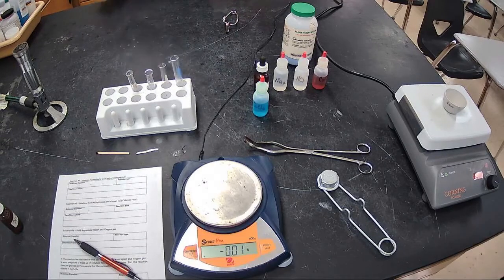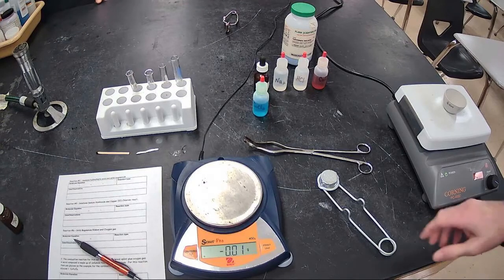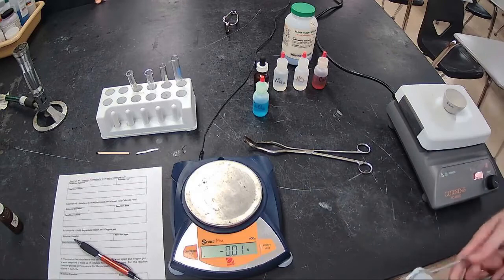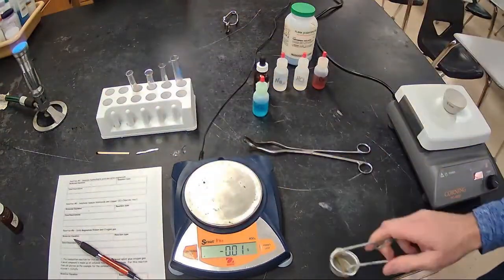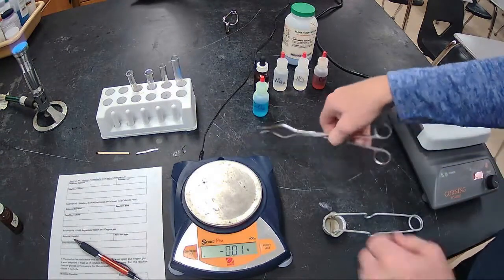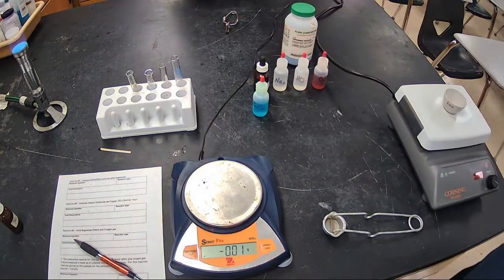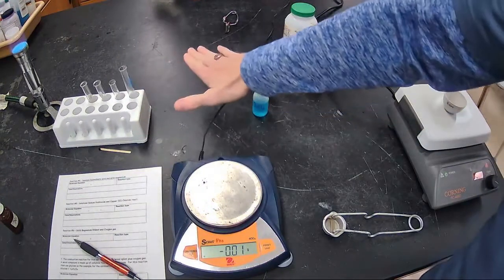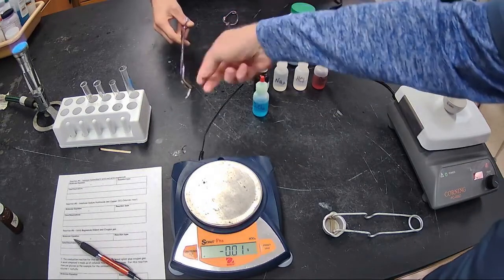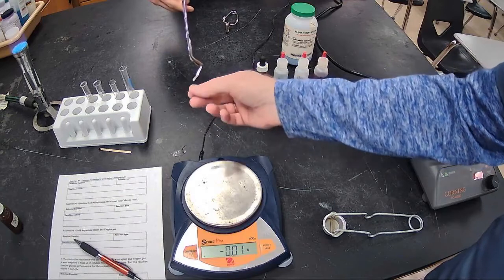Now reaction 6. At home, I don't think this will be quite as bright, but you don't want to stare at what's getting ready to happen, because if you stare at it, it will hurt your eyes. So we're going to light our flame again. I'm going to let Mr. Furiosi do this. We're going to take, forgot about this reaction, we're going to take magnesium metal. Just make sure when you're doing it, you hold it right here so they can see it. We're going to take magnesium metal, which you can see is still very, very malleable, flexible, and we're going to burn it.